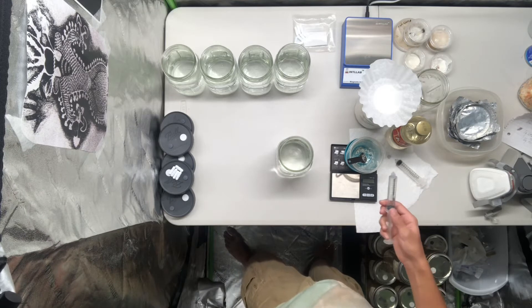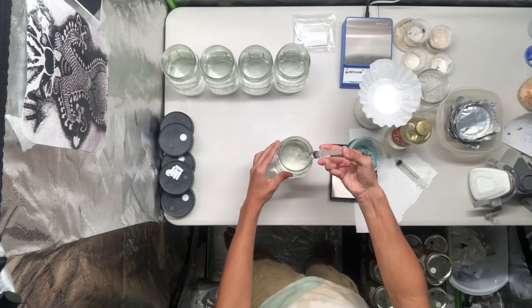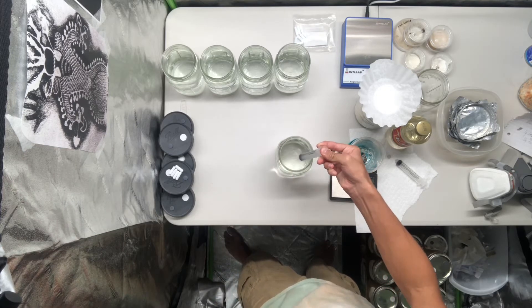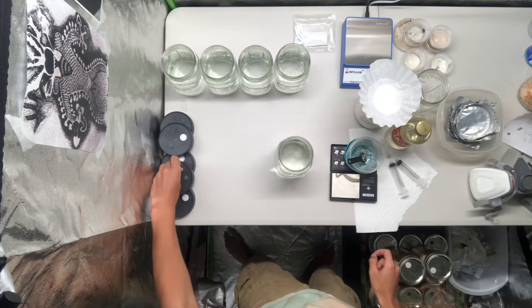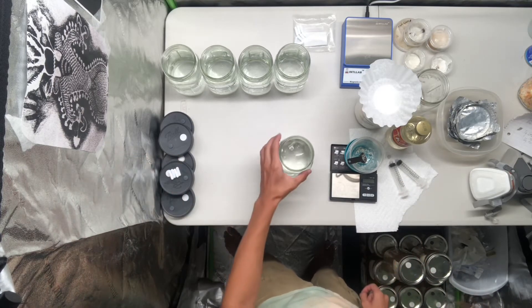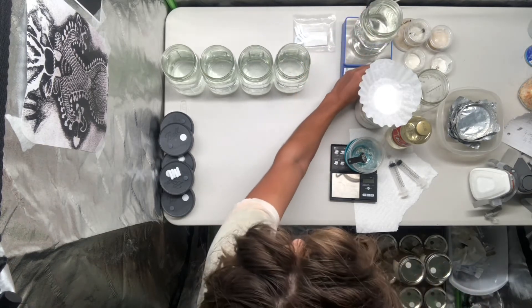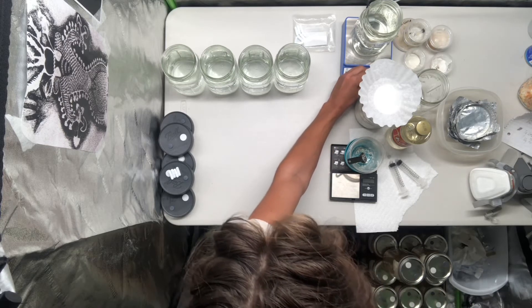The Karo works pretty well. It's just sticky so it can kind of be inconvenient for clean up afterwards. Then we can just add the stir bar and set it on the plate to stir it up. You can also use warm water to improve solubility.